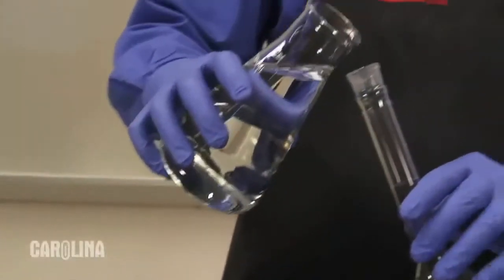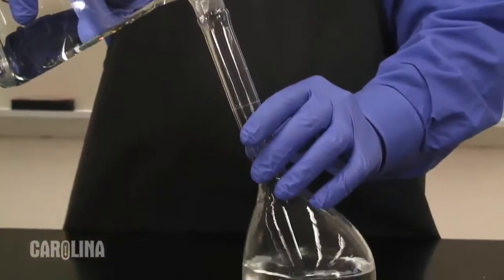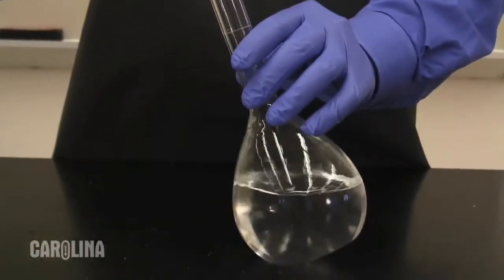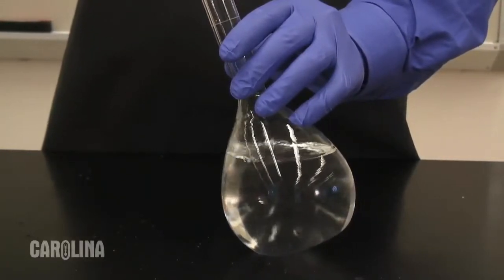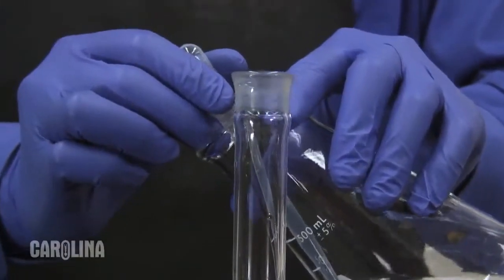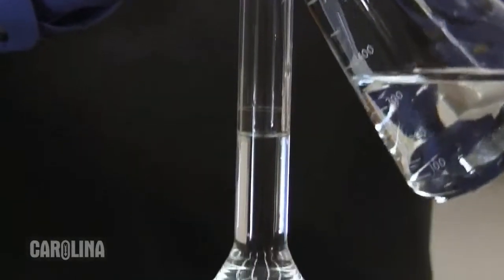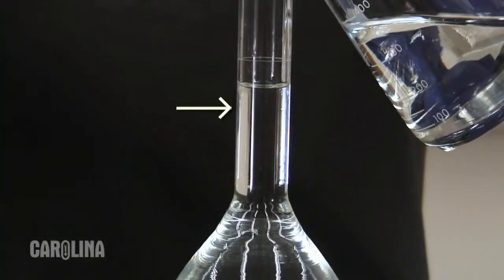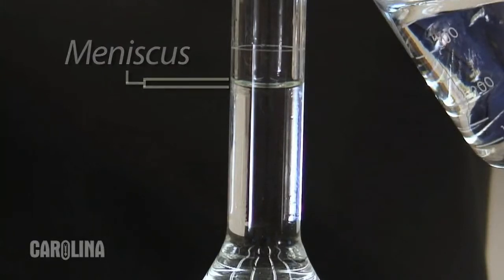Now that the sodium chloride is completely dissolved, we can fill the rest of the bulb area and some of the neck with water. You should now carefully and slowly add water, our solvent, as it begins to fill the neck. Once you approach the etched or printed line on the neck of the flask, you should add solvent dropwise, monitoring the location of the meniscus. Water, as a polar solvent, tends to cling to the glass walls of a flask. This phenomenon creates what is called a meniscus. The bottom of this curved meniscus should sit directly level with the line on the flask.